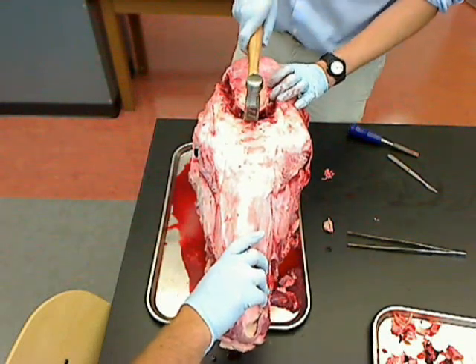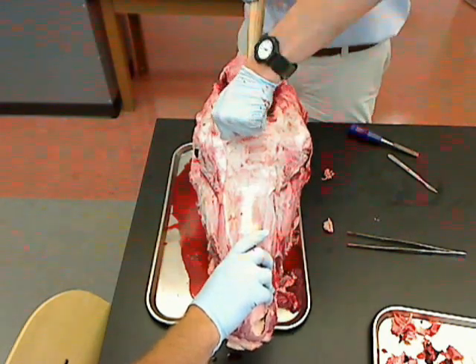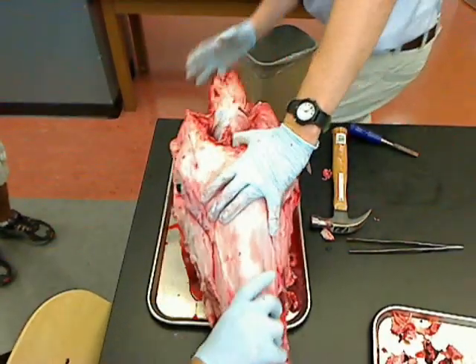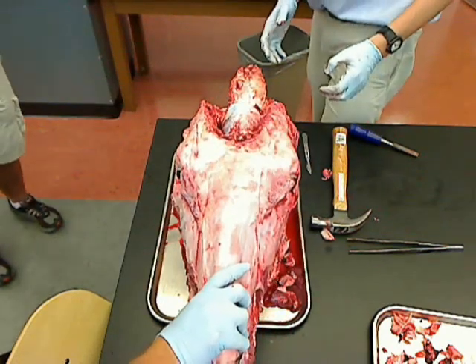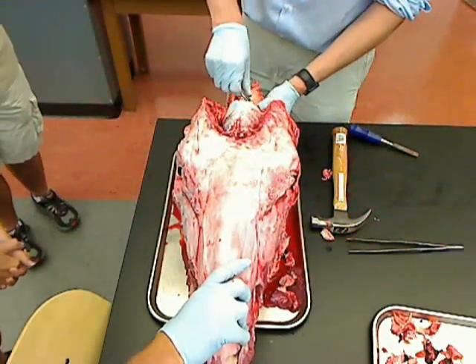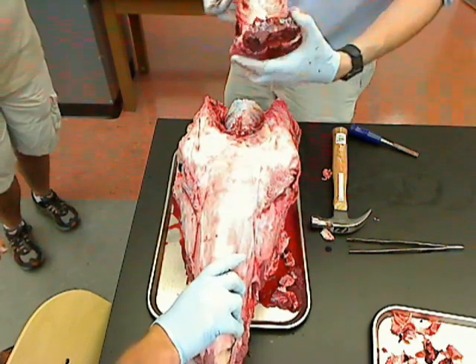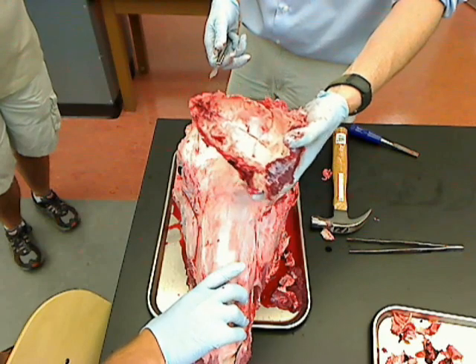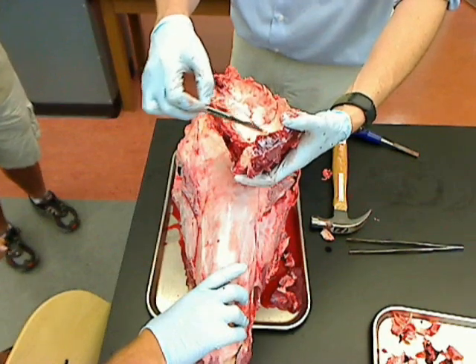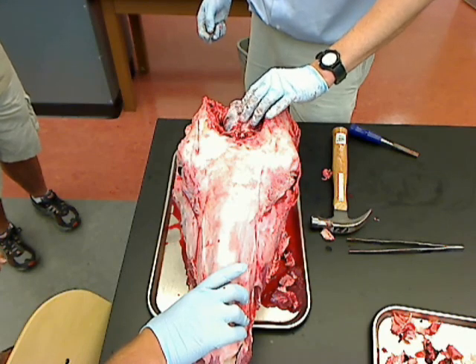And that's down here. There we go. That is the interior of the cranium — parietal plate, parietal plate, occipital bone.